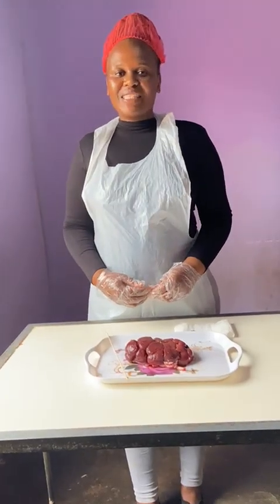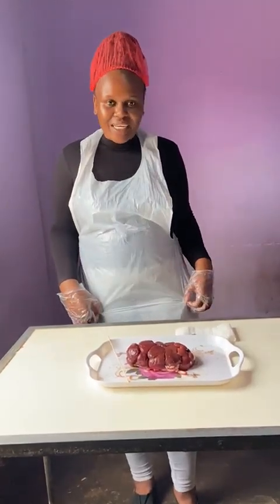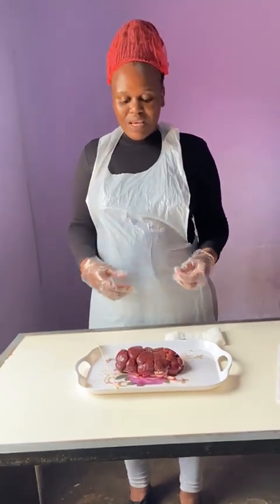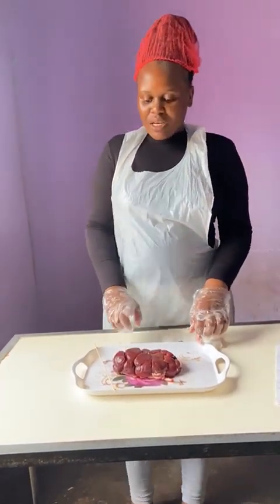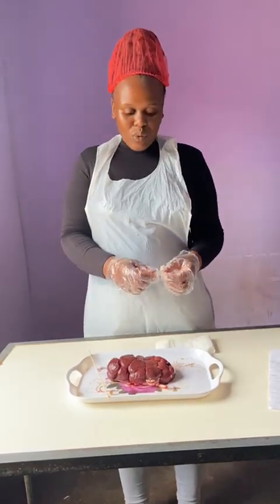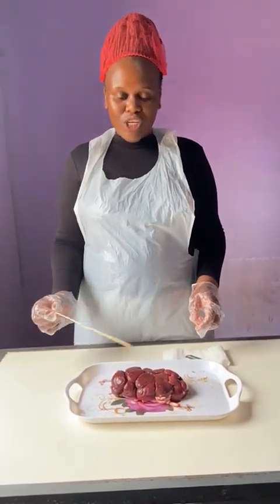I have improvised the following. As you can see, I have improvised a lab coat. I am wearing a plastic white butchery coat, and I am using disposable gloves instead of laboratory gloves, and I am using a plastic tray. Another thing that I have improvised is the scalpel. I will be using a blade instead of the scalpel, and I will be using the wooden stick to point at the kidney structures.